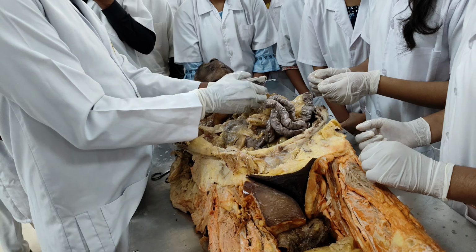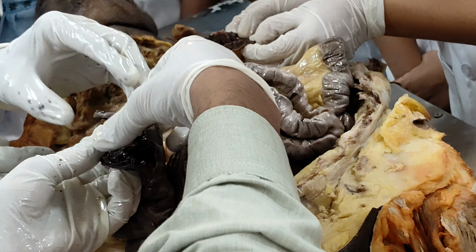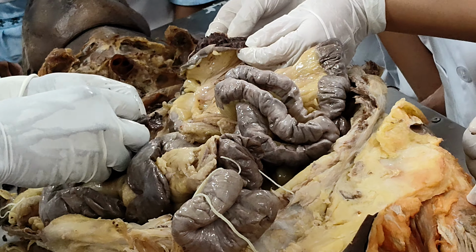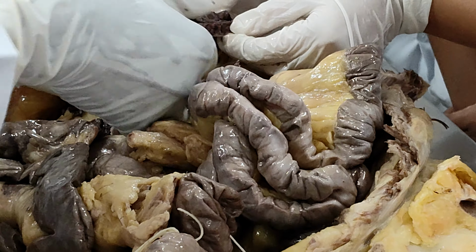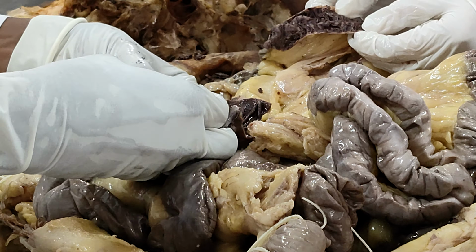Now we are seeing. Right, you can see the differences, right? See how thick they are. They are thick, but here they are thin and less dense. They are very sparsely arranged, but these are thick, longer, and numerous in number.